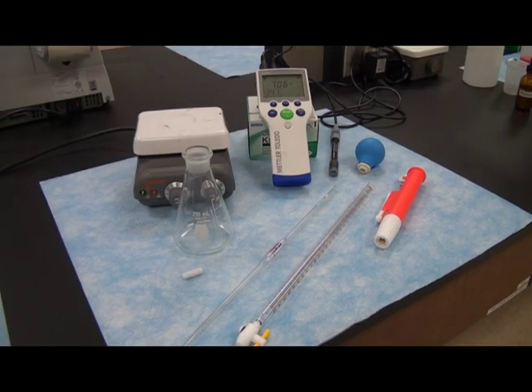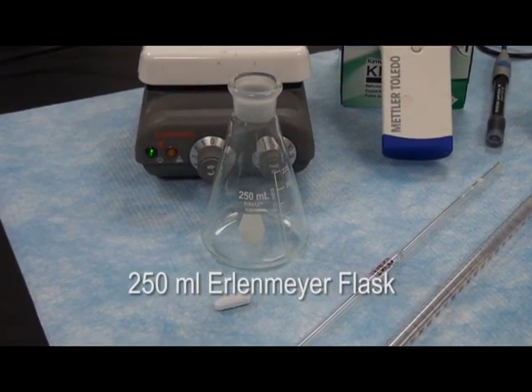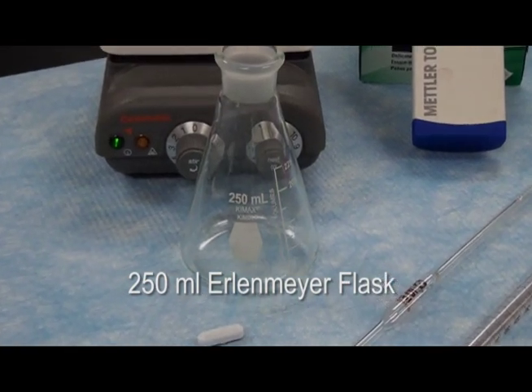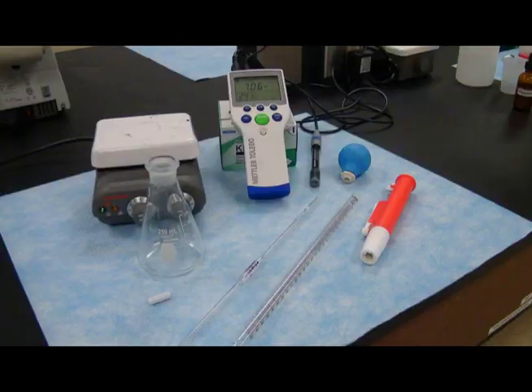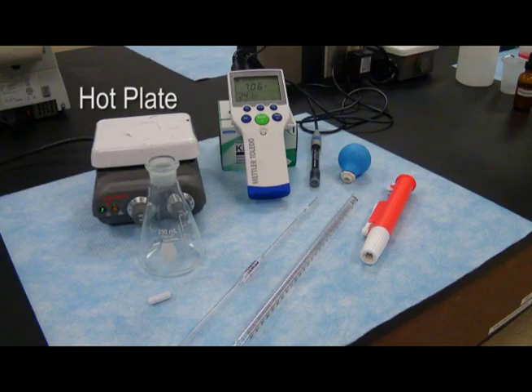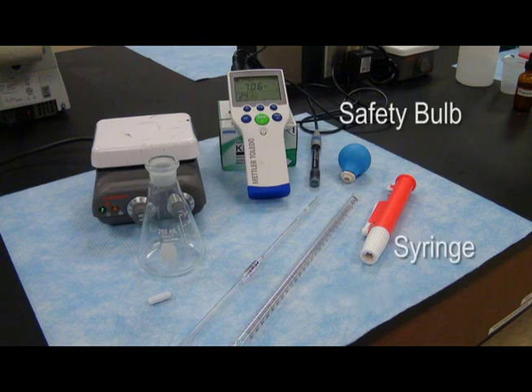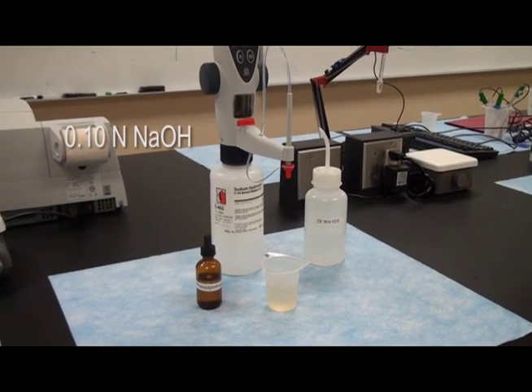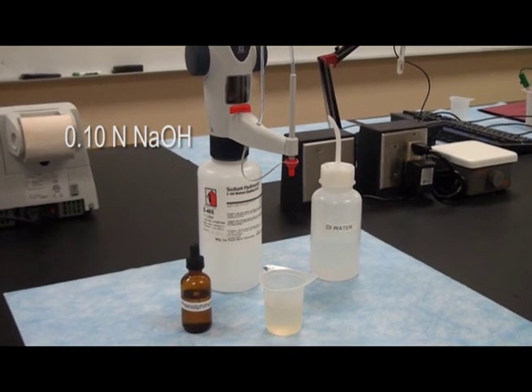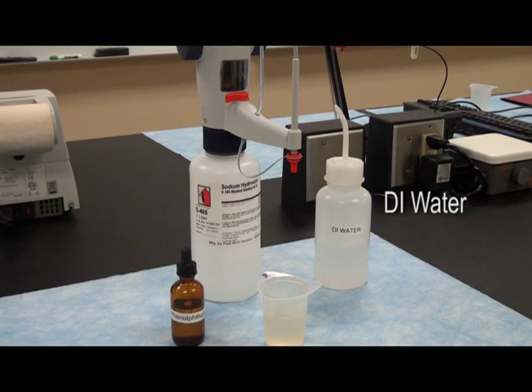The following equipment will be needed to measure the TA of a wine or must sample: a 250 ml Erlenmeyer flask, a 5 ml volumetric pipette, a hot plate, a 10 or 25 ml burette, and a pipette safety bulb or syringe. Supplies needed include 0.10 N sodium hydroxide, phenolphthalein with an eyedropper, and distilled water.